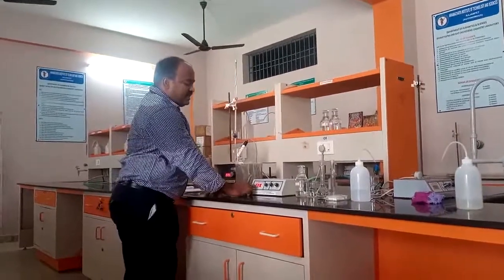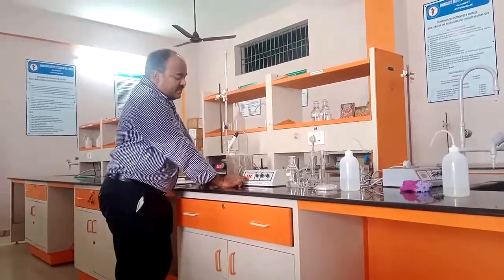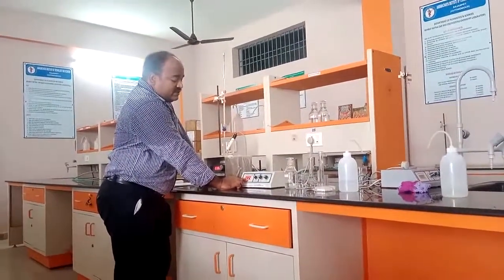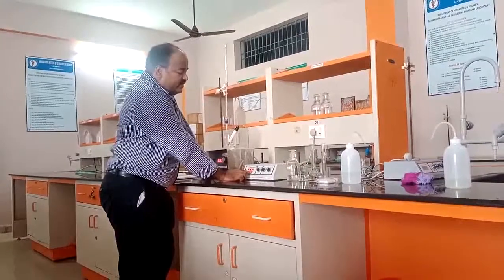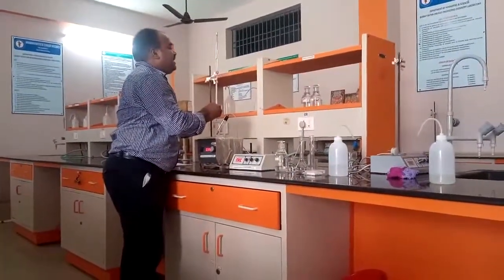See, now it is increased slowly. Before it was 2.9, now it is increasing slowly. Now it is constant. Yeah, now it is constant. This is 3.4. Before it was 2.9, now it is 3.4. Again I am adding another 0.5 ml.